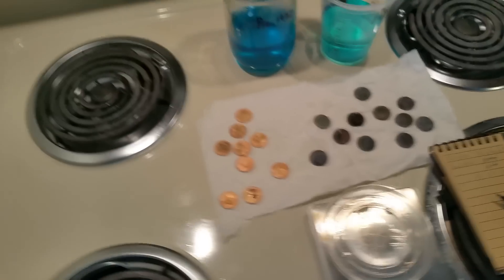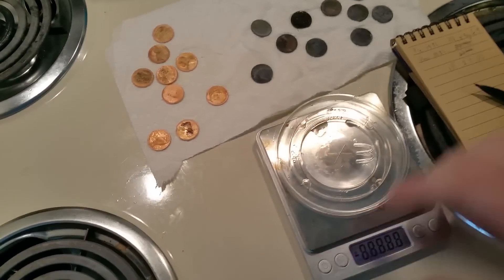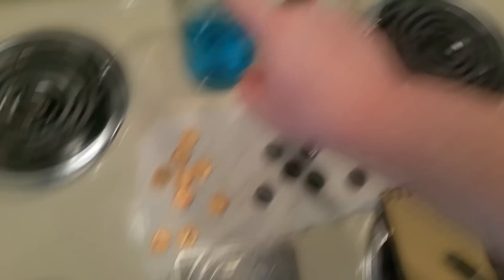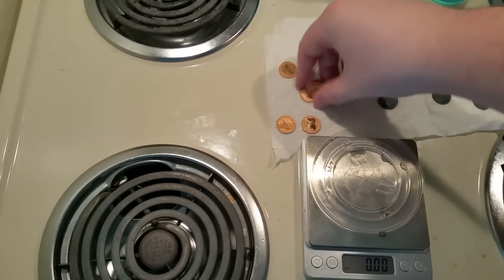So far I've shown you two methods to make copper acetate — one involving copper sulfate and one involving copper metal. Of the two, I would say that copper sulfate is probably the cheaper option and you can control it a little bit more.